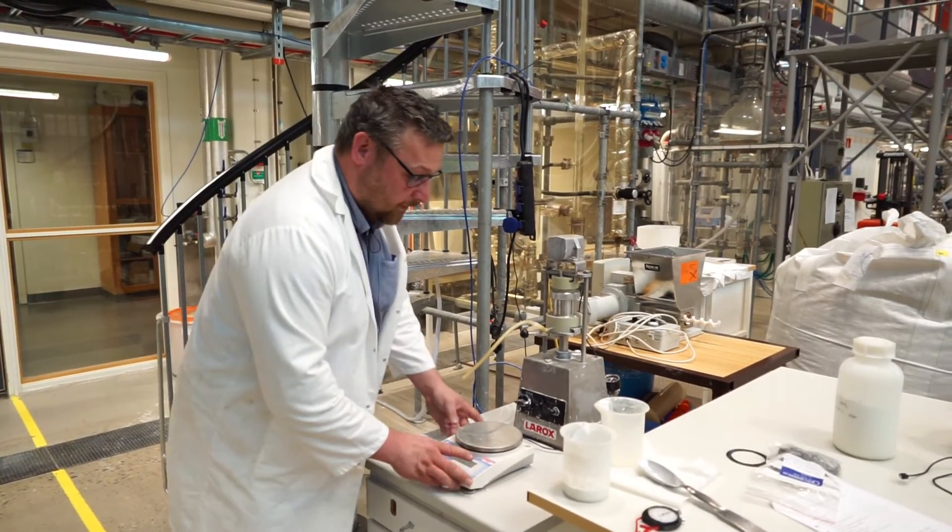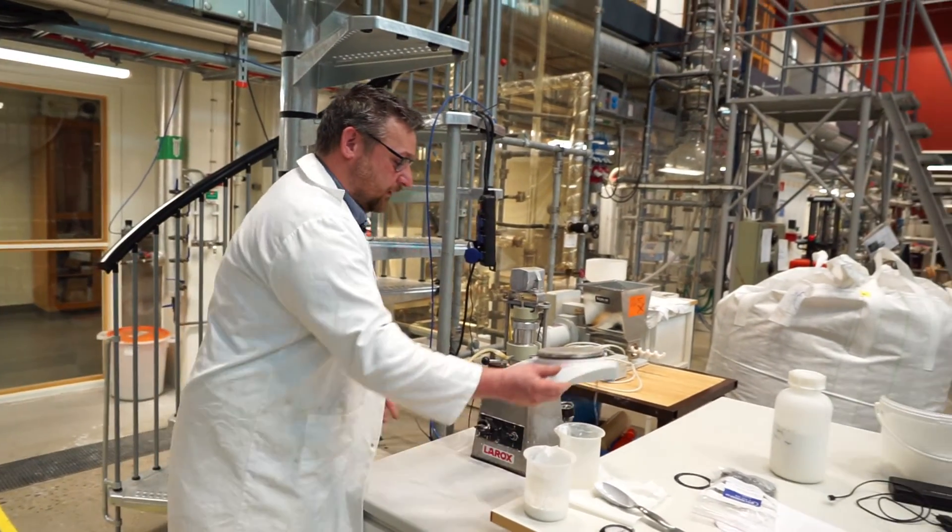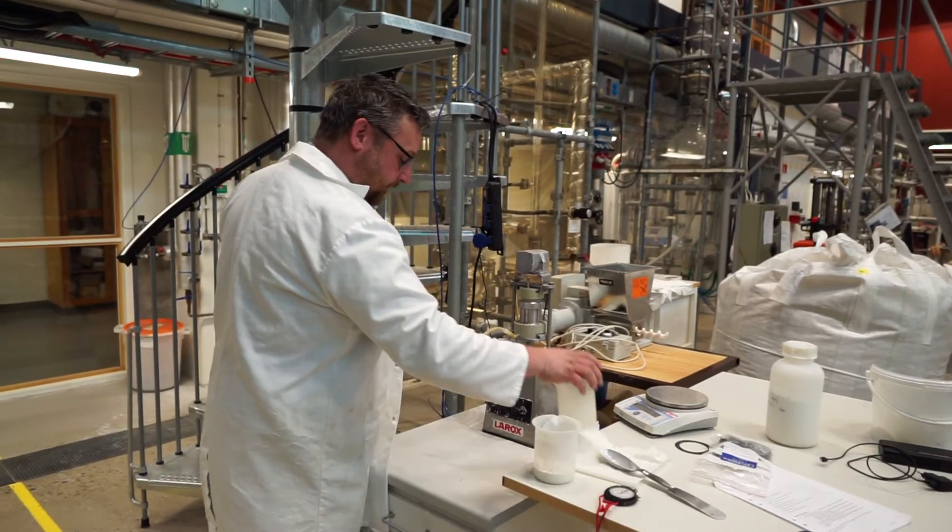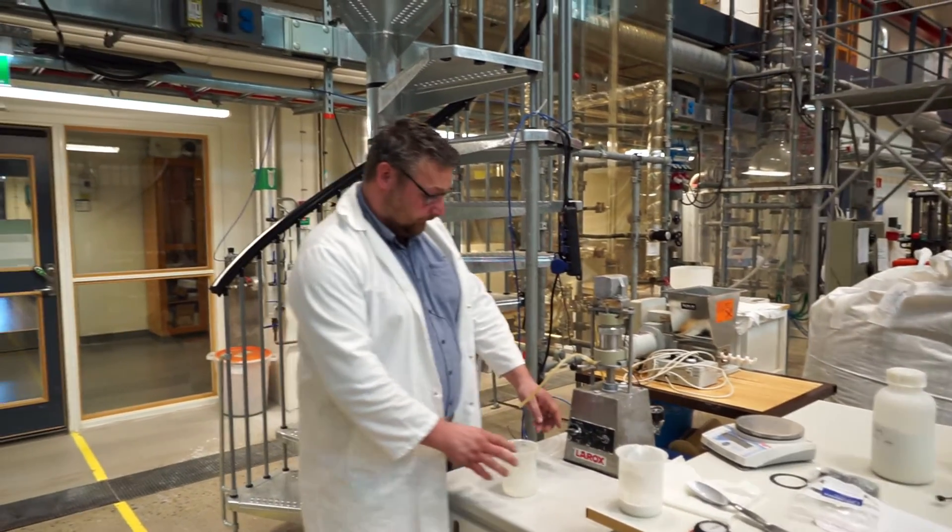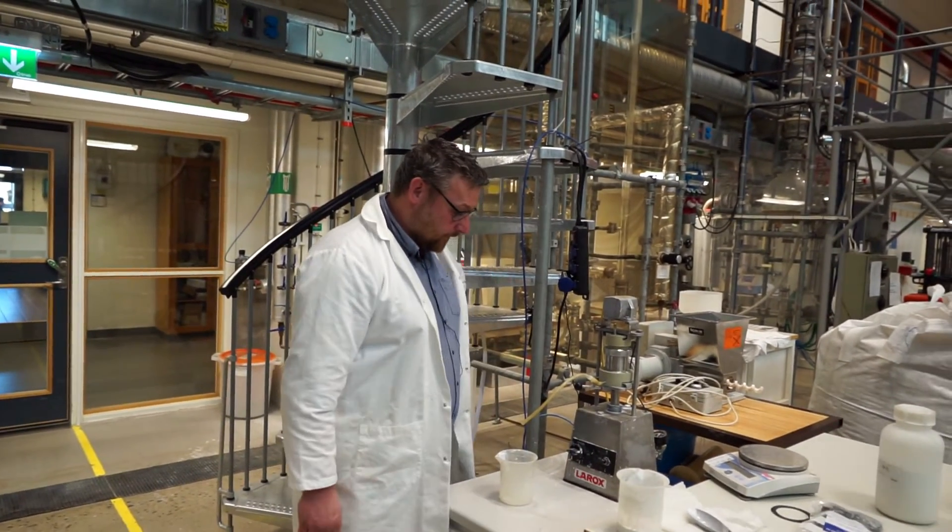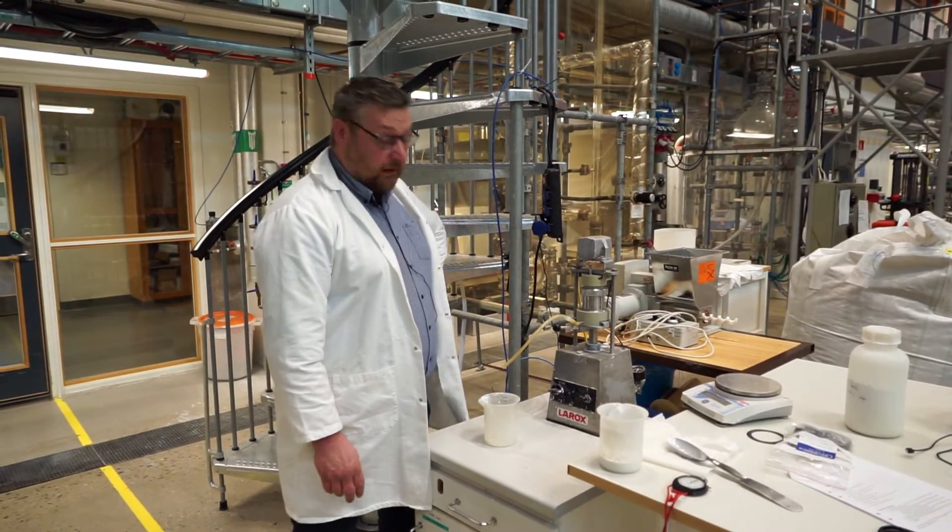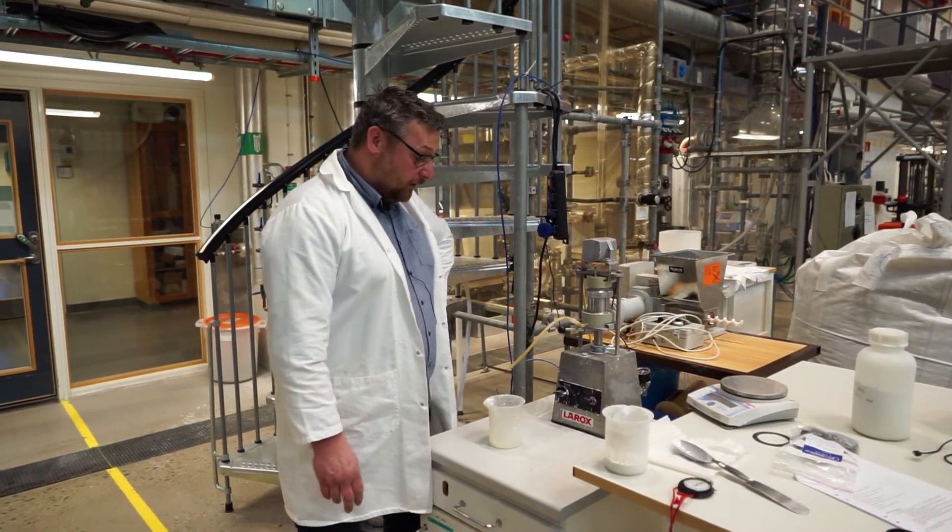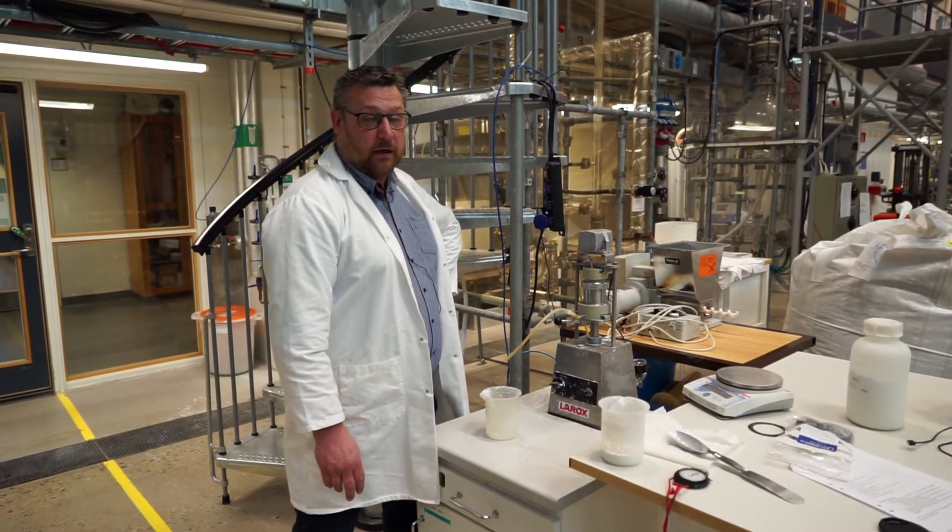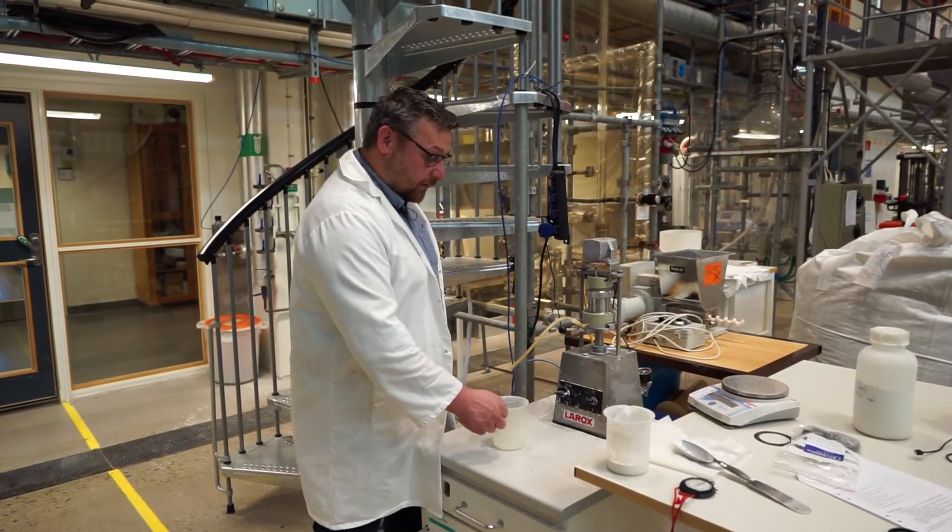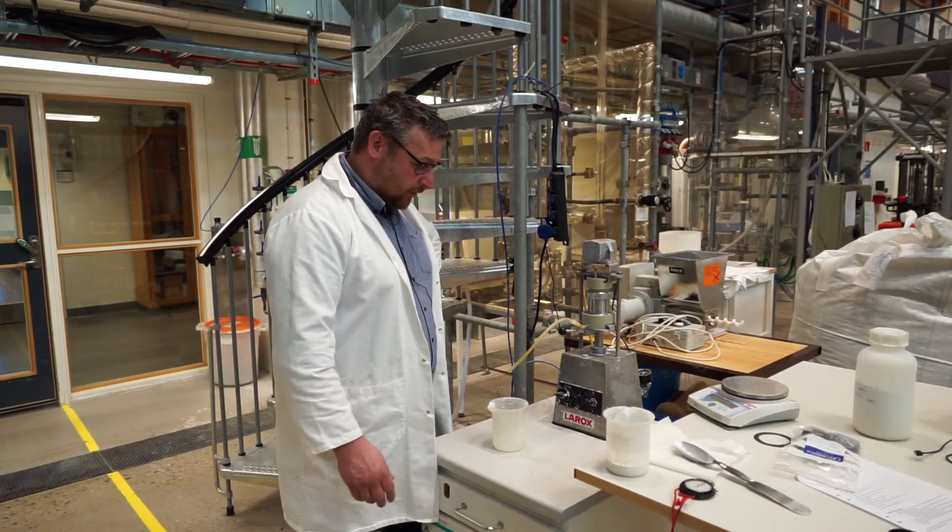And I'm just moving this a bit. Because now we're preparing for the next group to come to do the lab, so to say. So now it's basically just the cleanup left, or you redo this at different pressures to get the filtration characteristics at different filtration pressures.